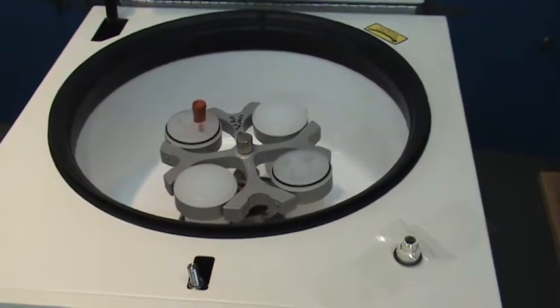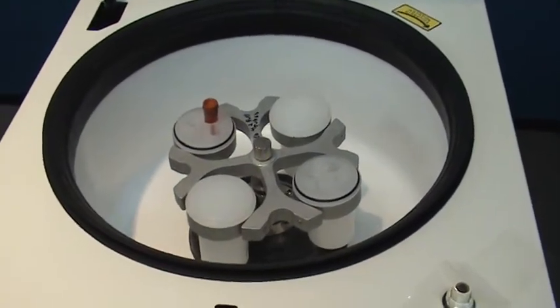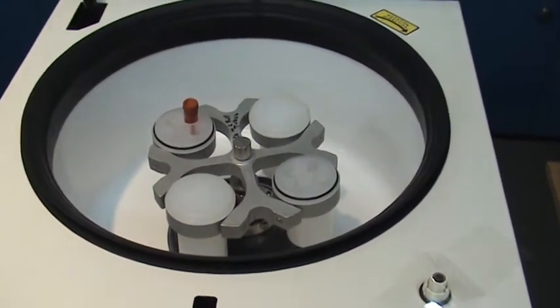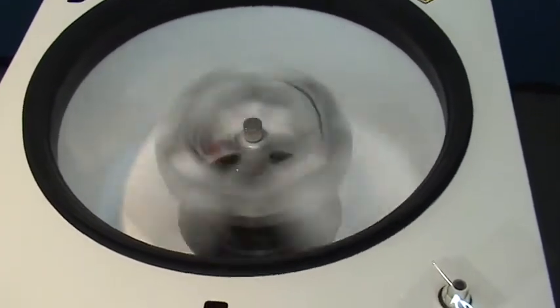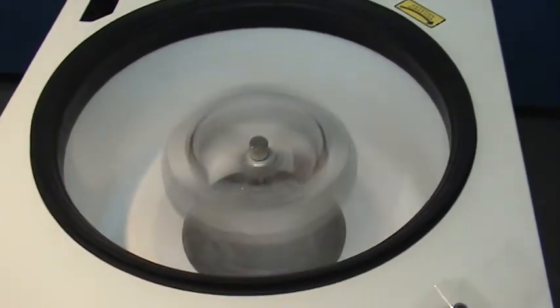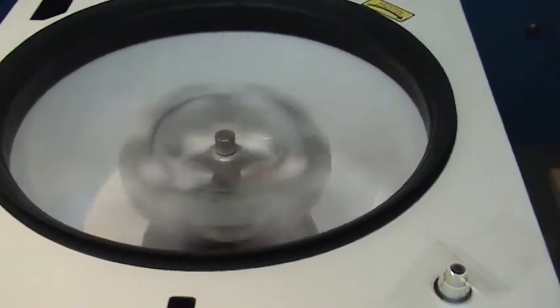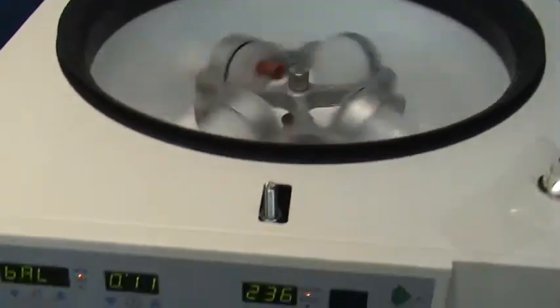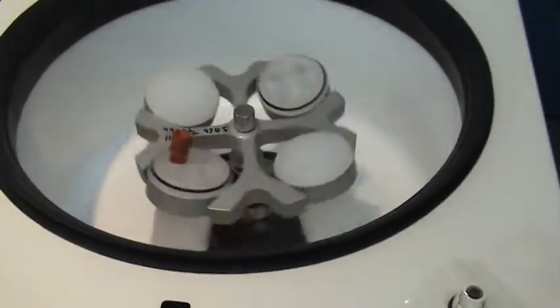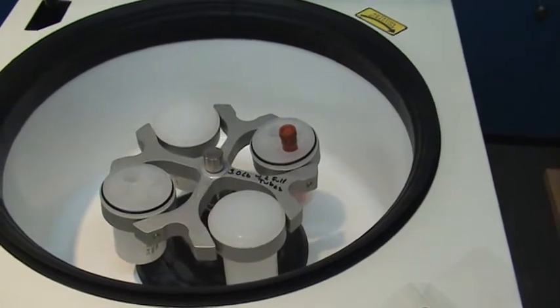We will temporarily override or bypass the centrifuge's normal lid interlock system just so you can see the violence which occurs with a rotor that's this badly out of balance. And the machine's interlock system and software shuts off the motor rotation.